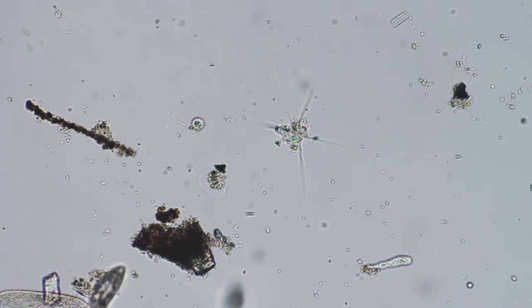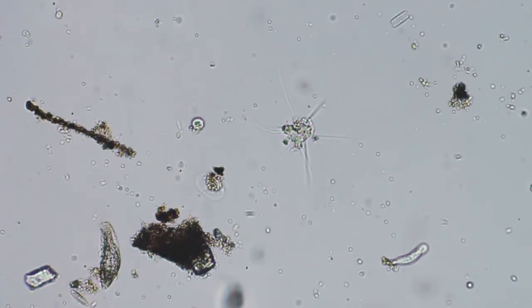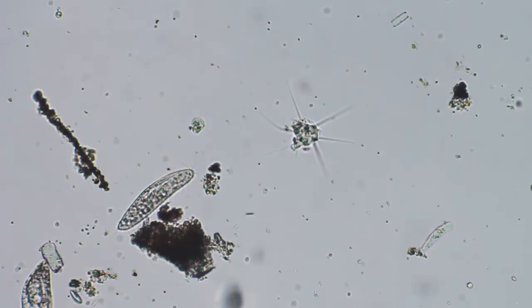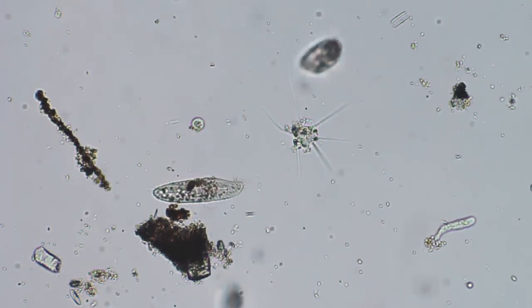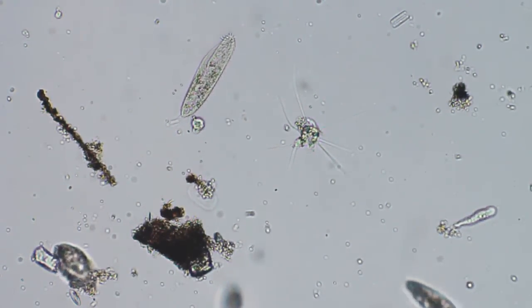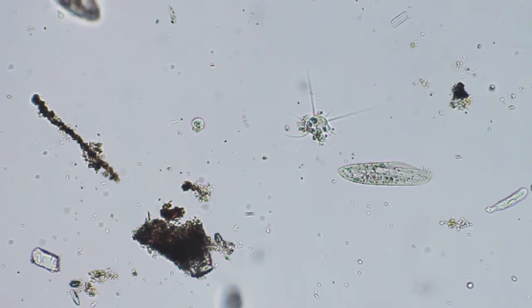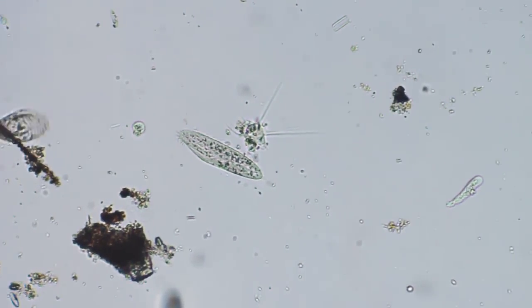What this is — I collected some moss from out in the woods and I put it in a petri dish and added some creek water. Let it sit; this has been fermenting for a week. It has a lid on it but the lid is loose so it has space to get air in and out. It's alive because it has plant matter in there — it's even growing some kind of spiky thing. It looks like new grass coming up or something similar.